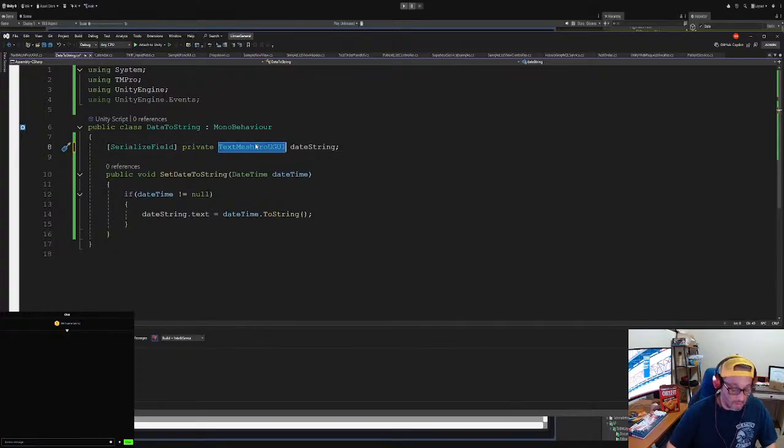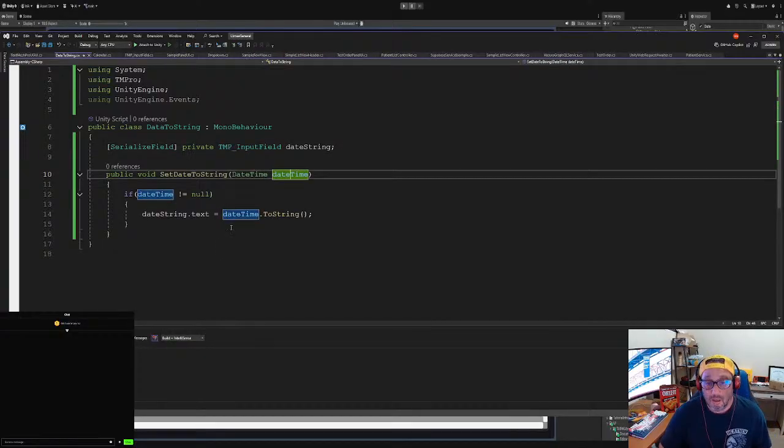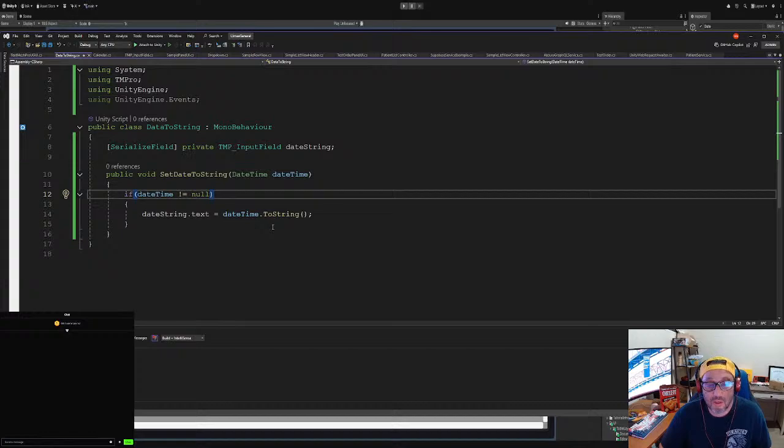Input field. We got to make sure that, okay, we don't have to worry about that too much. Let's go here. We'll be fine. Calm down. So delete this one.